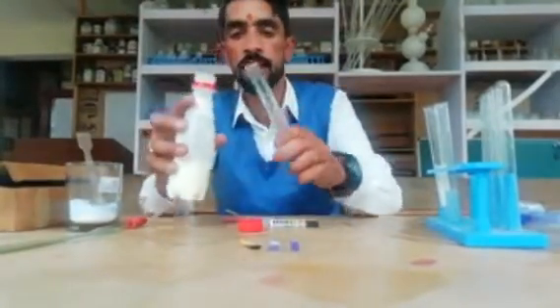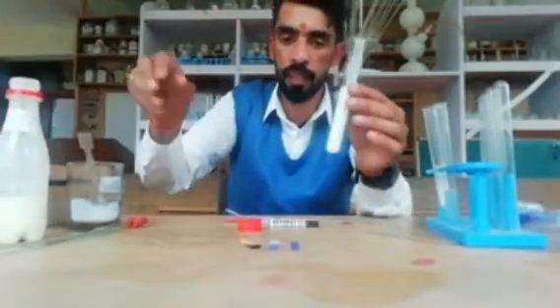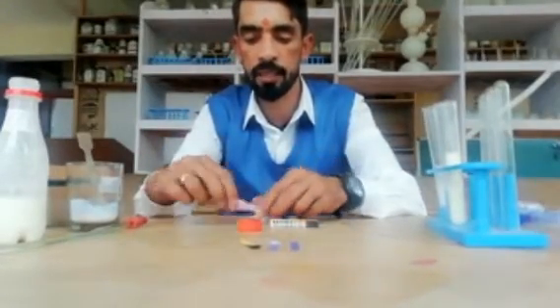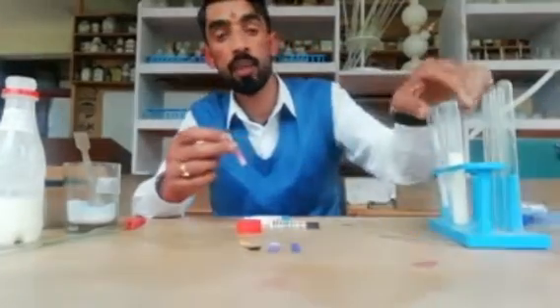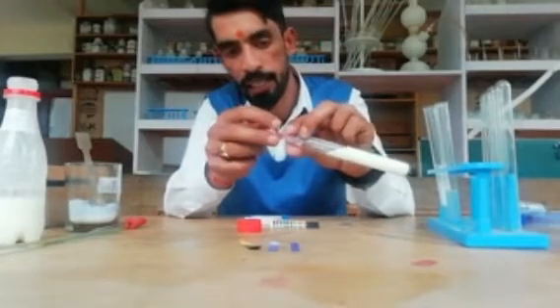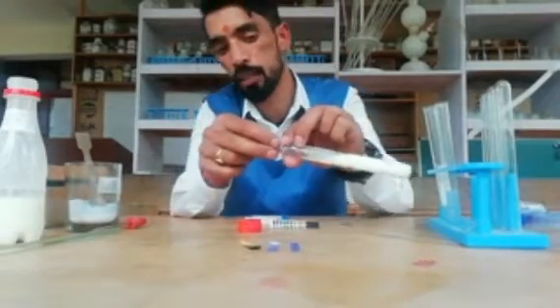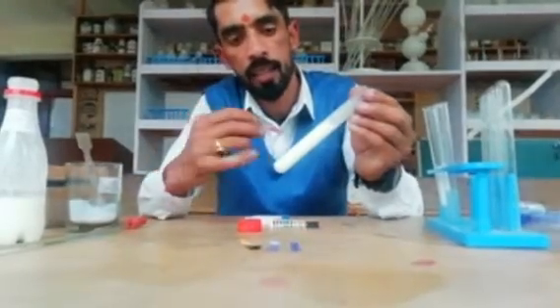Now we will take the second sample — we will make the solution of curd. We have made the sample of curd. First, we will check it with red litmus. The nature of red litmus in acid is that it is not going to change — red remains red. You can see the moment red litmus comes in contact with curd, the color does not change.